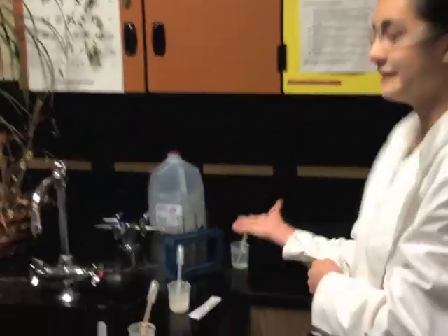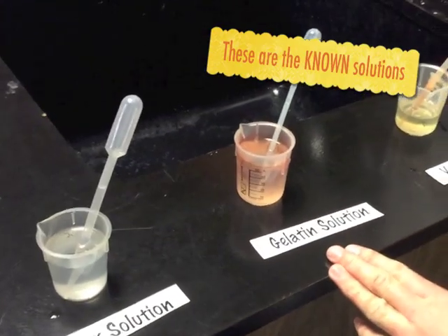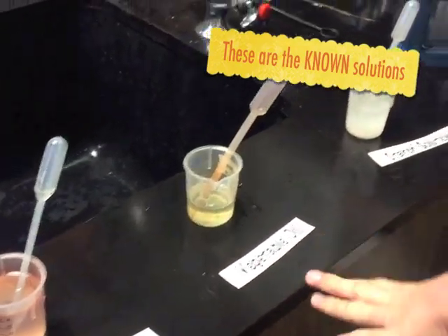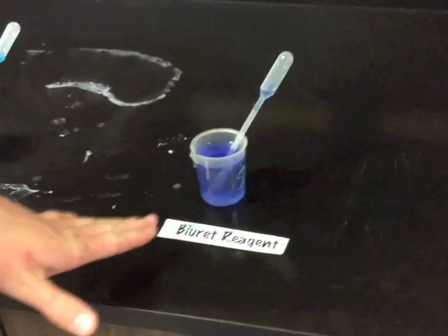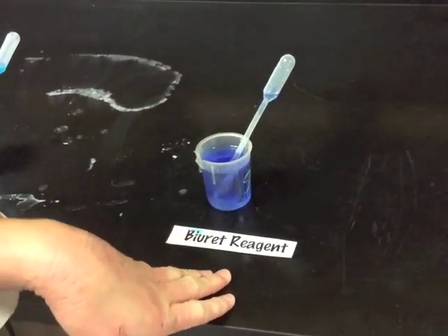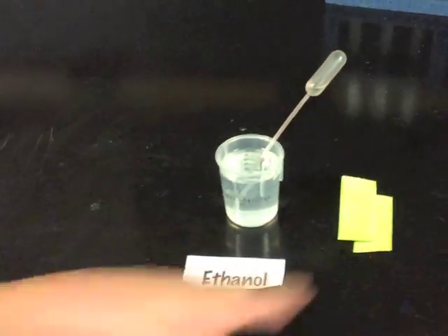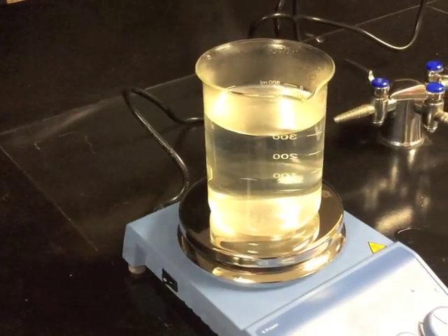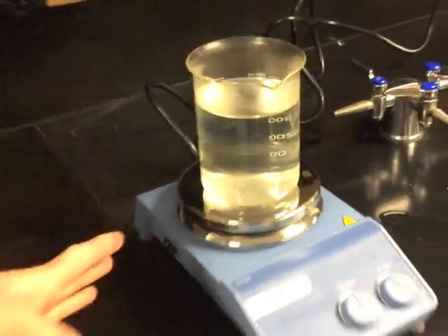To start off you'll need clean test tubes. You will test a sugar solution, a gelatin solution, a vegetable oil solution, and a starch solution. You'll use Benedict's solution to test for simple sugars, Biuret reagent which will turn purple if proteins are present, ethanol and green paper for the lipid test, and iodine to test if there's starch. You'll also use hot water to add heat to the Benedict's solution.